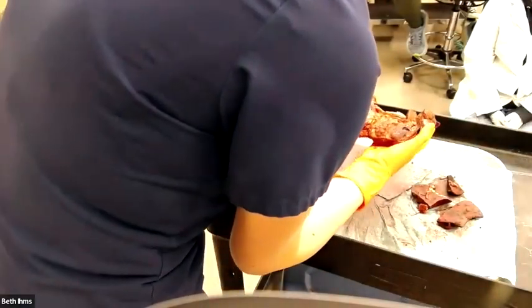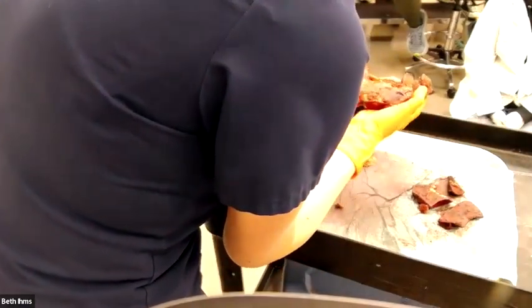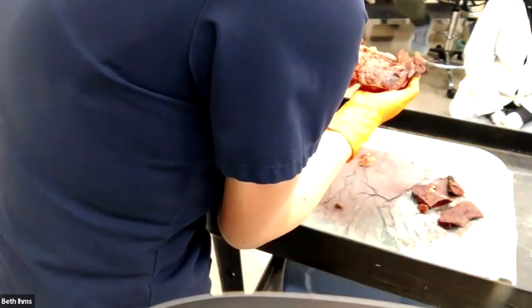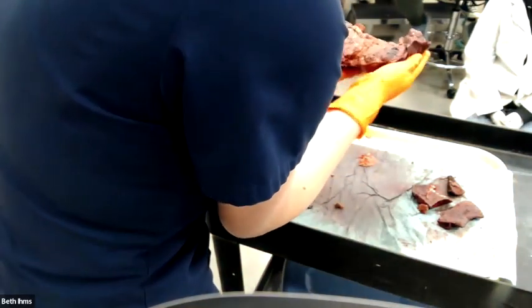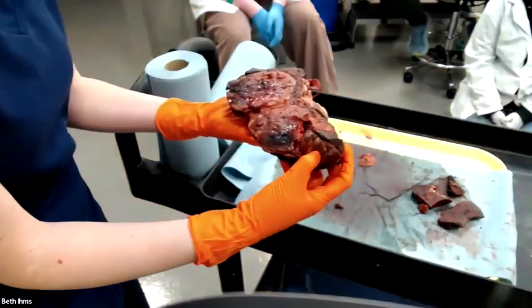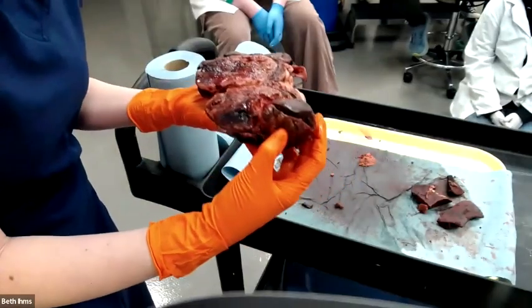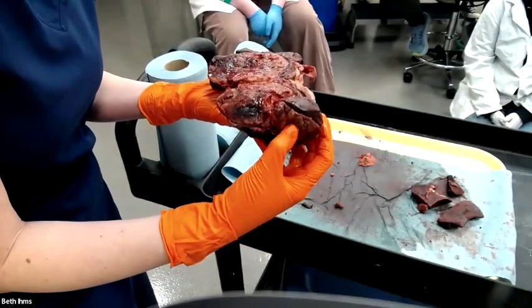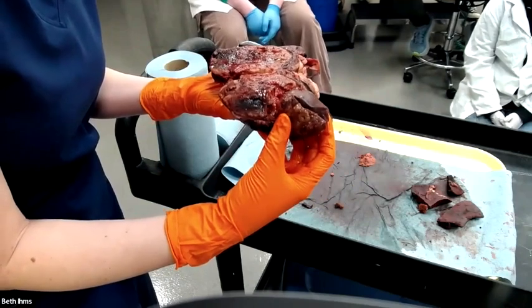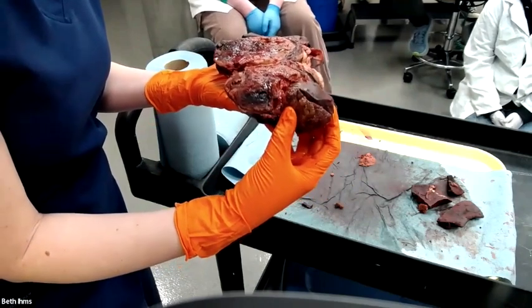Uncut section, the tissue is extremely soft. It's friable. It is multifocally discolored, yellow, orange to tan to black in some areas. And this little nodule right here, this is my favorite guy. See him? Oh yeah, right there. See that little dot in the middle? Can everybody see that that looks just like a belly button? That's umbilicated.